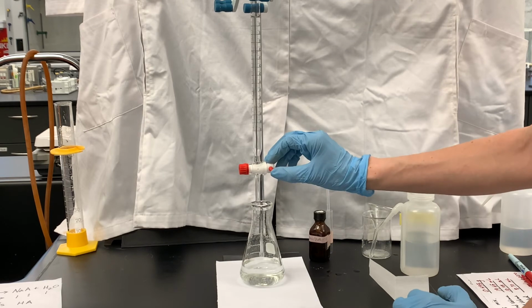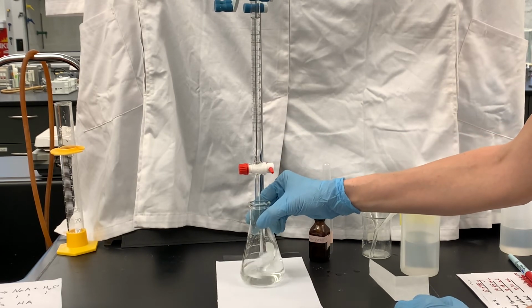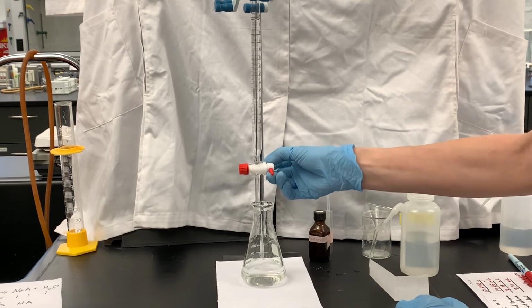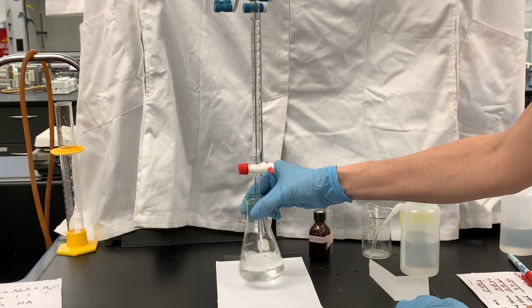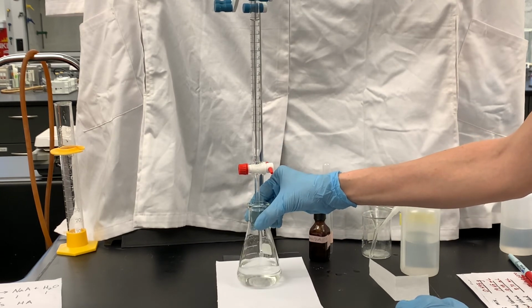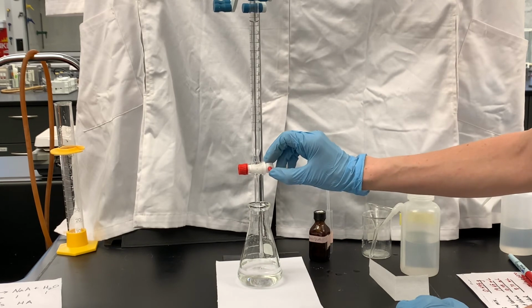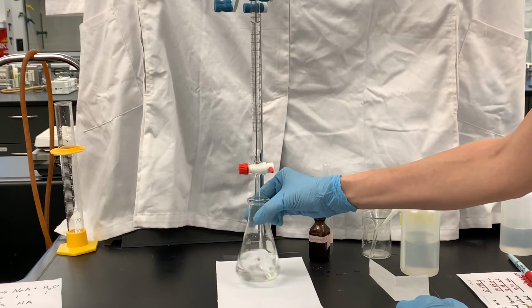The phenolphthalein color change is actually at a pH that is higher than 7, so the indication is actually past the equivalence point. When the color changes, you've actually gone a little bit past the equivalence point, but it's close enough that we get pretty accurate results. So it's definitely really close.